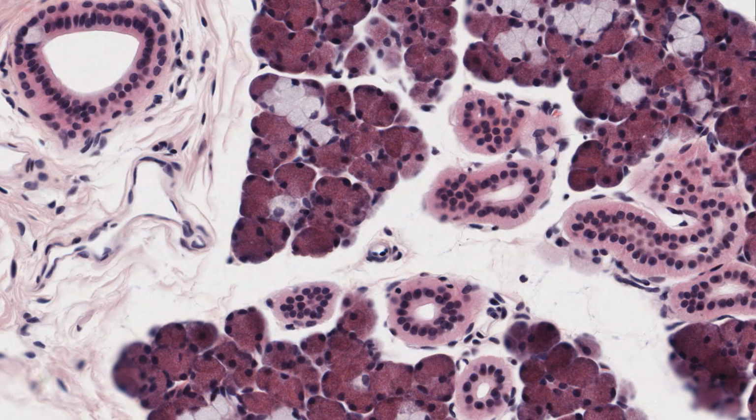Whereas the epithelium lining this larger tube would be referred to as a stratified cuboidal epithelium, because the surface layer of cells are cuboidal. Although I can understand that you may look at this part of the epithelium and say, this looks like a stratified columnar epithelium, because these surface cells have elongated nuclei. I'll try and resolve this confusion later.